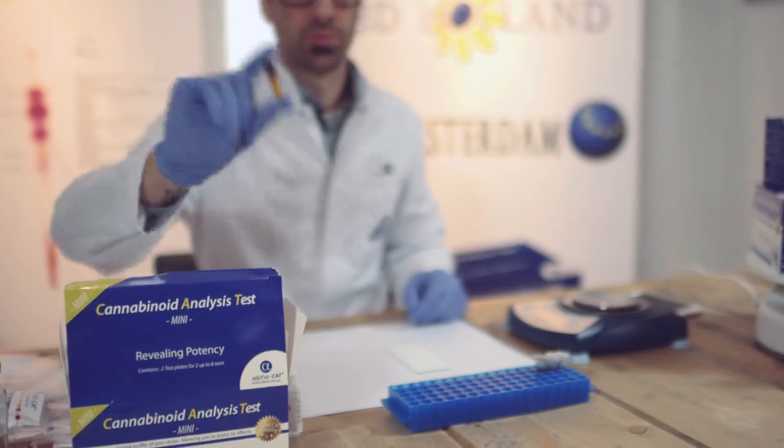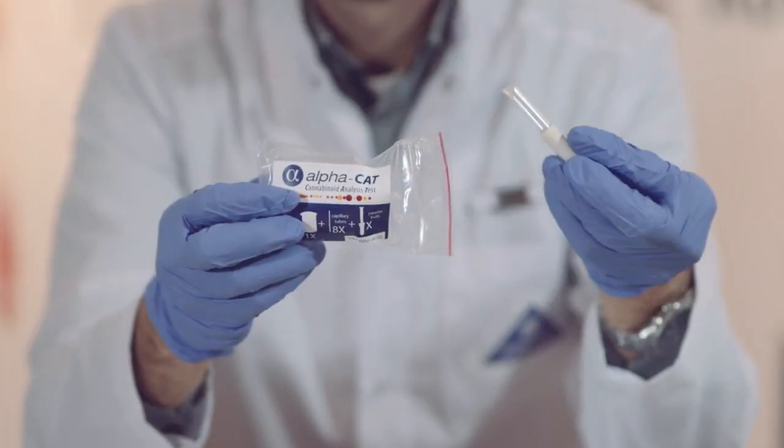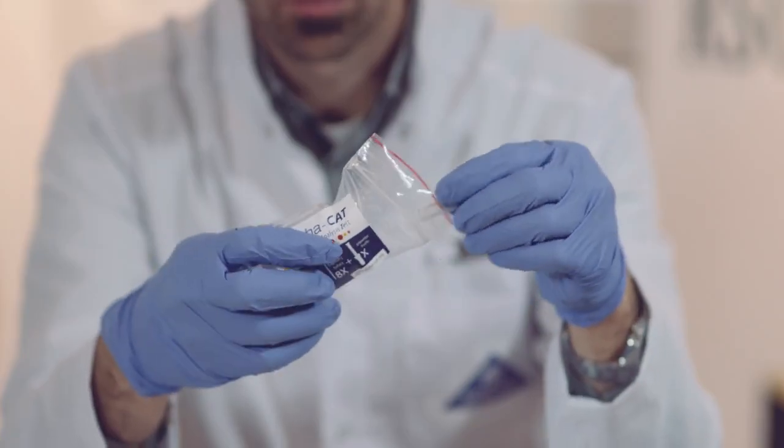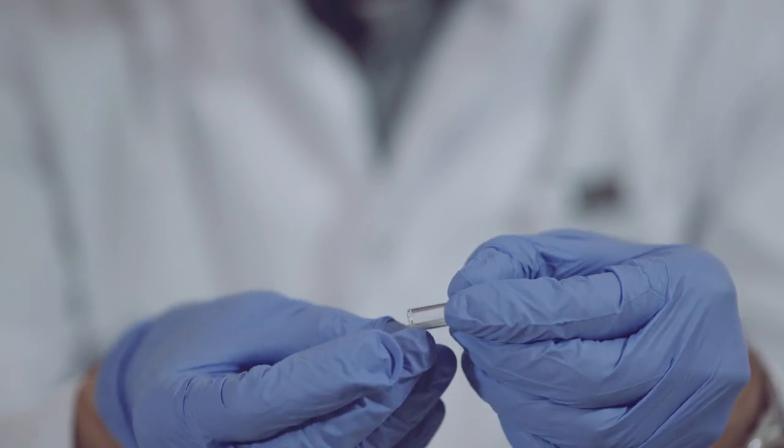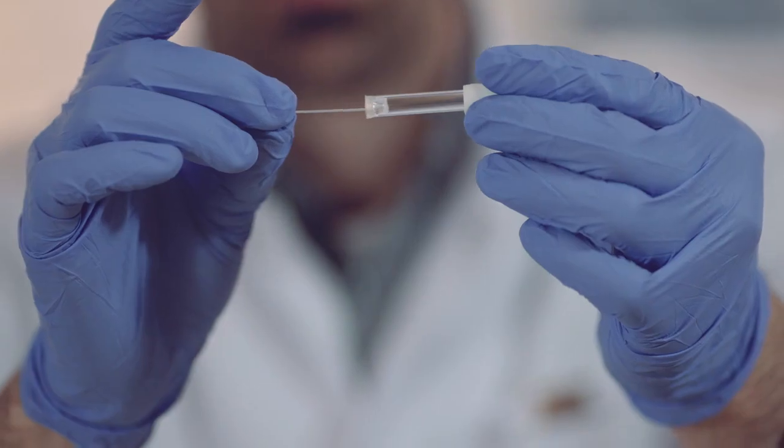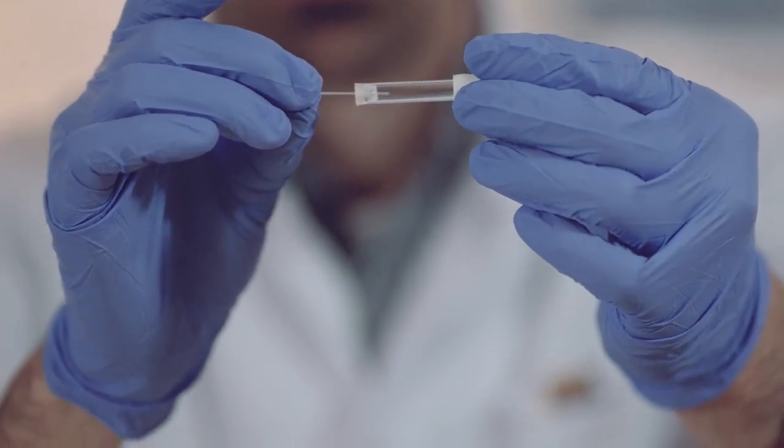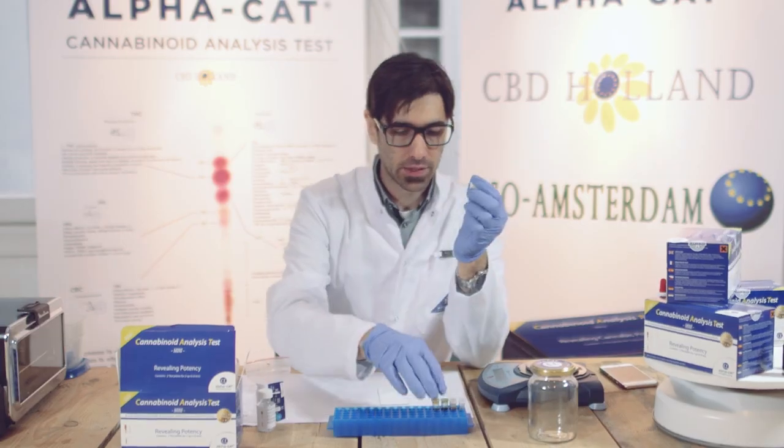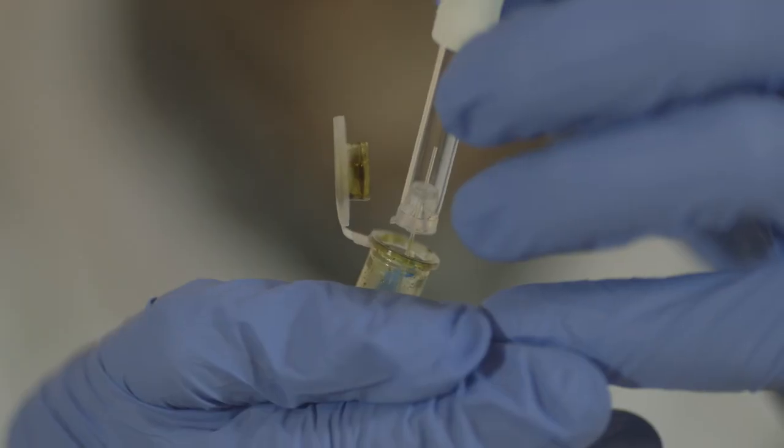Then proceed by holding the capillary tubes with its bulb holder. Use one capillary tube to take a drop of the sample solution by dipping one end of the capillary tube into the extraction tube solution. Make sure that the capillary tube absorbs one microliter automatically and is full to the top.